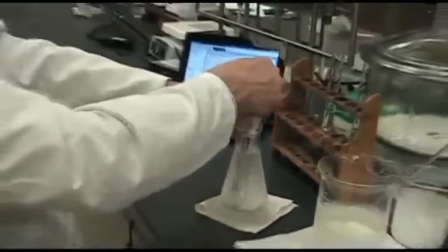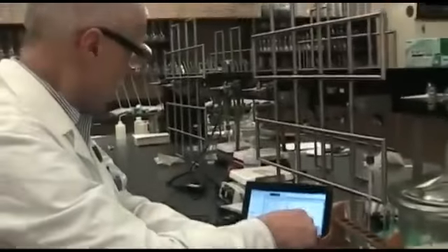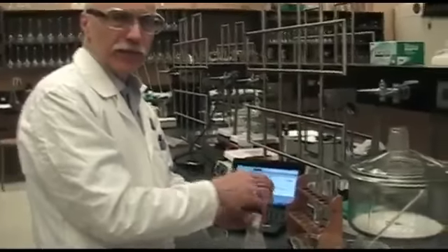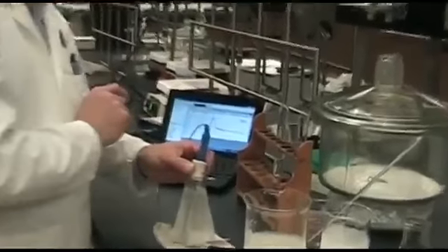So we have some slush beginning here, and we're down to -4.3. So we'll keep stirring it, and we'll go the length of the 10 minutes as we did for the sodium chloride. So we've reached our run of 10 minutes, so I shut it off, and we'll do glucose next.